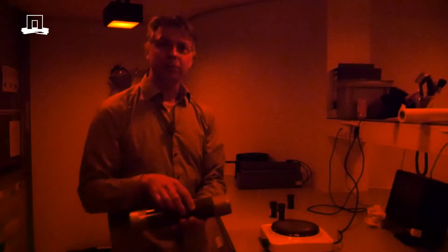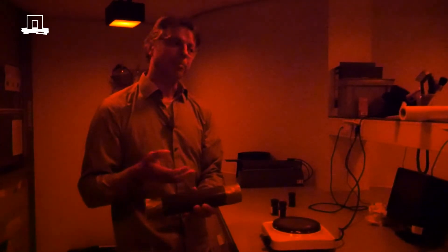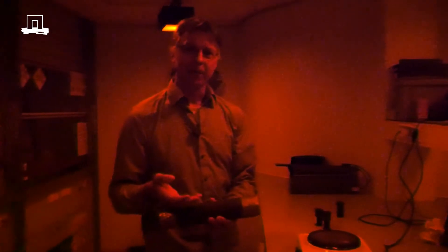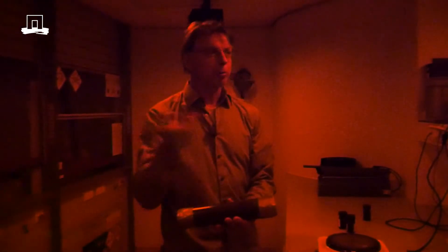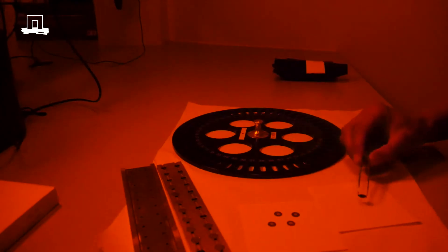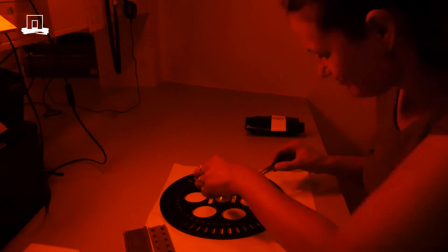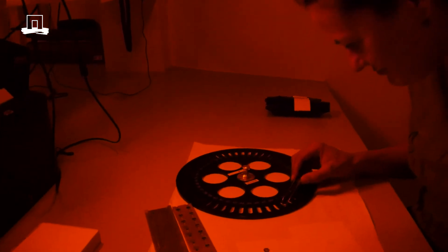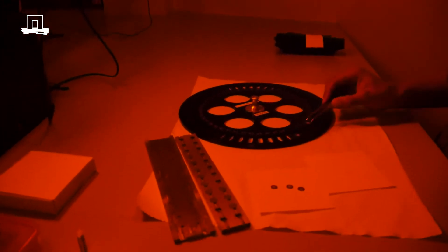The other part from the inside of the tube we have to get pure quartz or feldspar grains from. We use this lab to sieve the sample and prepare it chemically to get these pure quartz or feldspar grains. As a final step, we load the quartz grains onto small measurement discs.